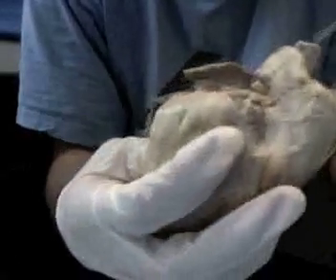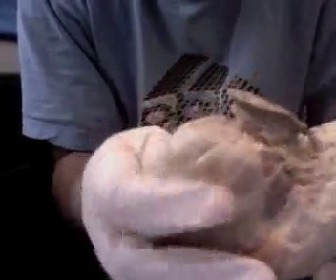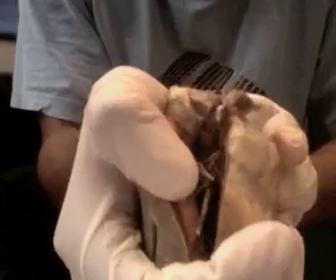And then on this side, you would have your aortic semilunar valve, but it is pretty deep. But if I stick my probe in from the aorta into the ventricle, it does have to cross through your aortic semilunar valve. That is everything.